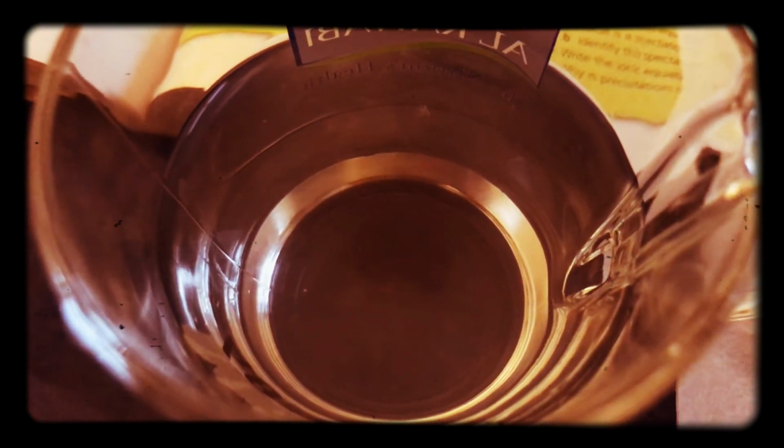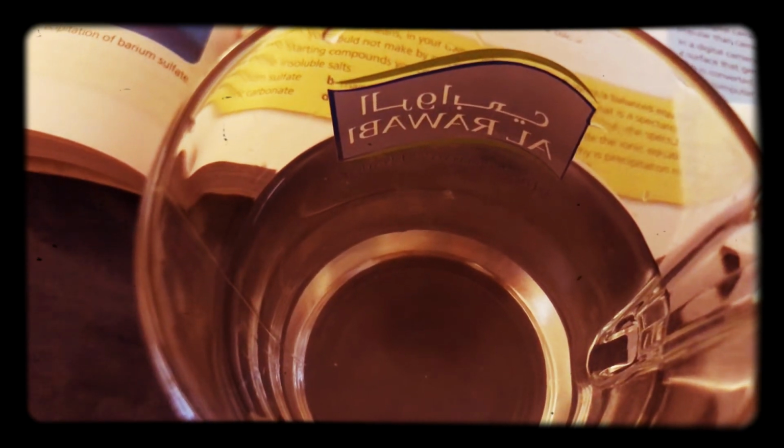So we're used to that type of phenomenon, and pretty much the salts that we have been looking at have been salts that are soluble. And it might be interesting to note that there are some white little bits of powder in here. And you might think, sir, your experiment's not working. You can see one or two in there.